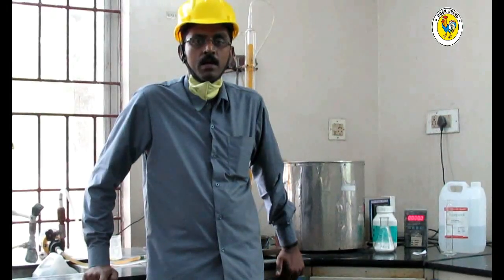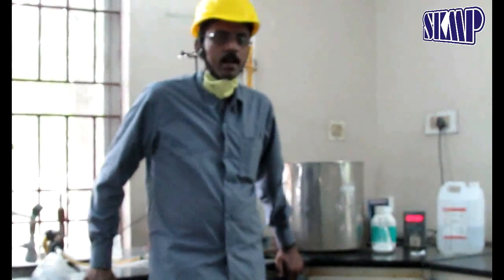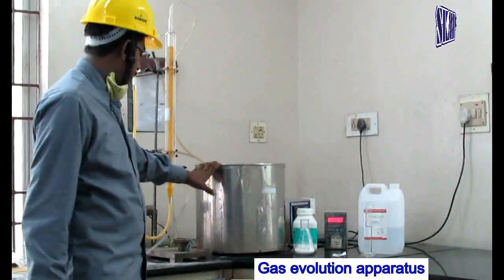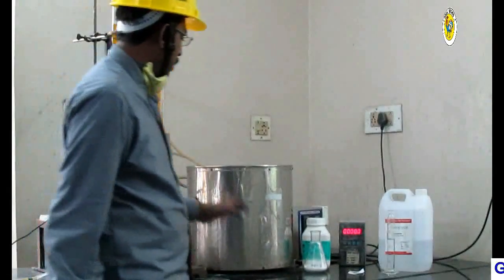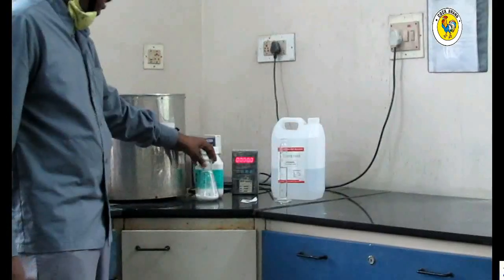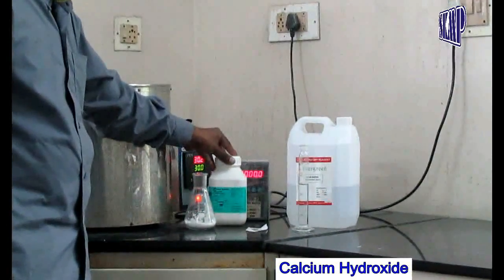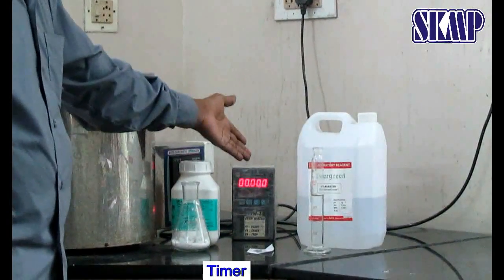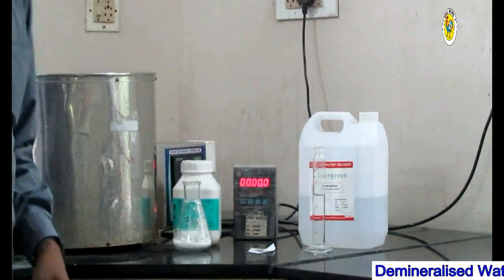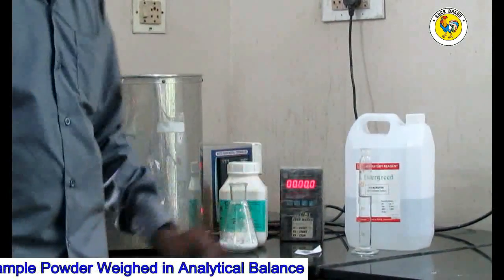For this test we require the following materials: a gas evolution test apparatus, a 250ml conical flask, calcium hydroxide, a timer, DM water, an analytical balance, and aluminium powder.